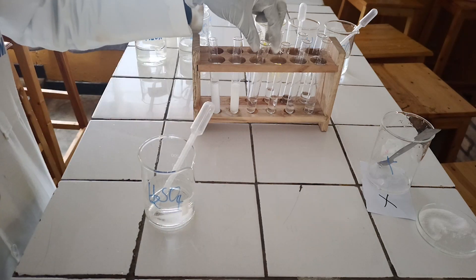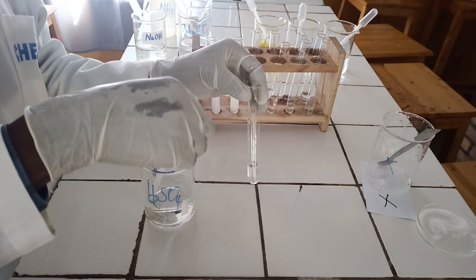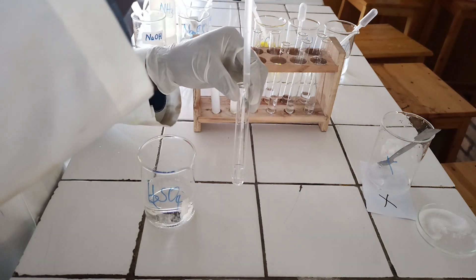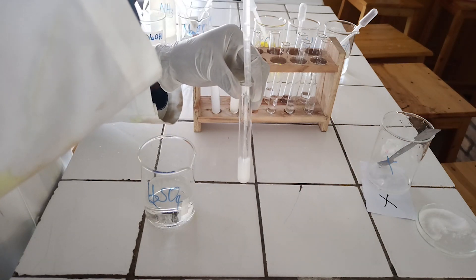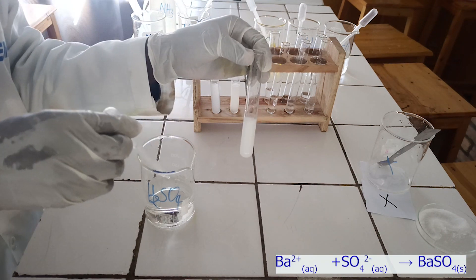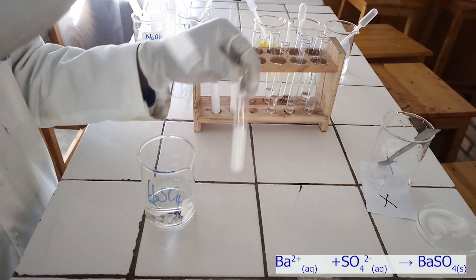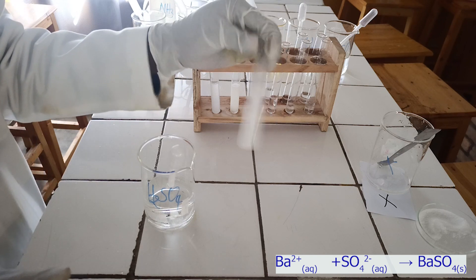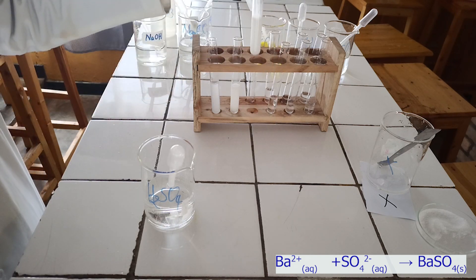To the third test tube, add diluted sulfuric acid solution. As you see, diluted sulfuric acid reacts with barium ion to form a white precipitate. Below, there is the ionic equation for this reaction.